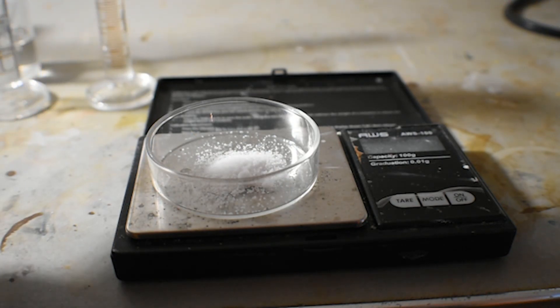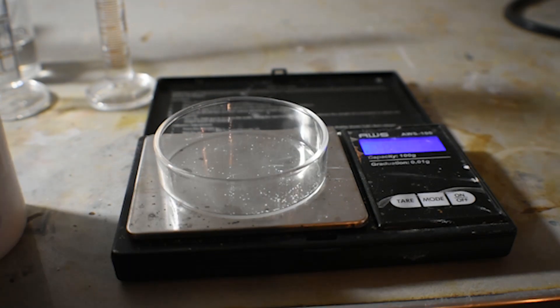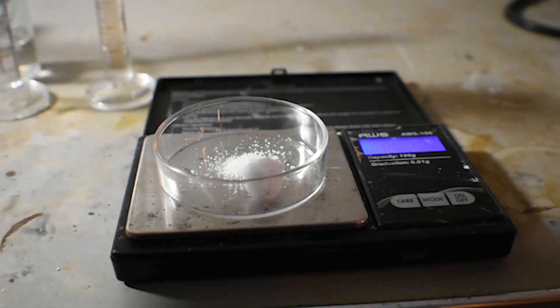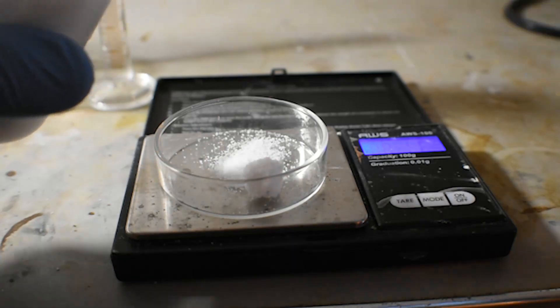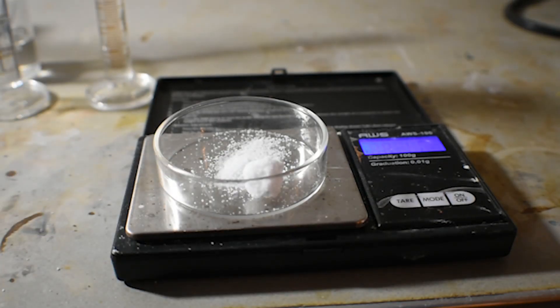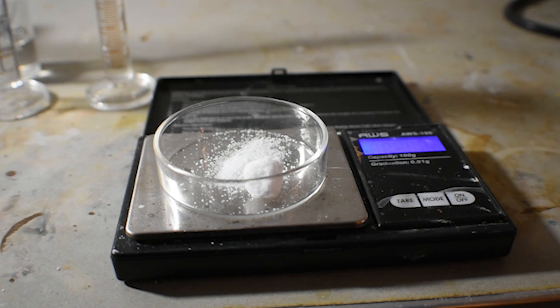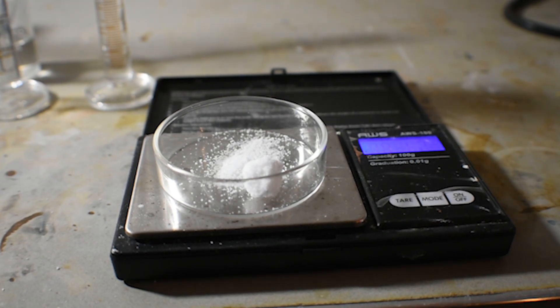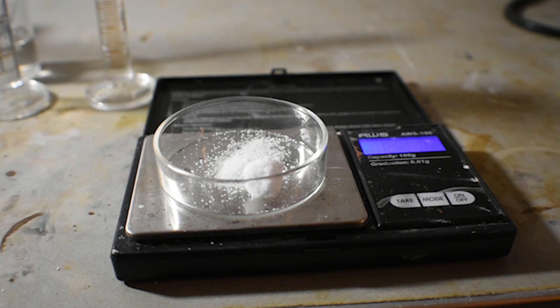Are you kidding me? The scale turned off, what the hell? There we go. I've got 0.75 grams of sodium borohydride.